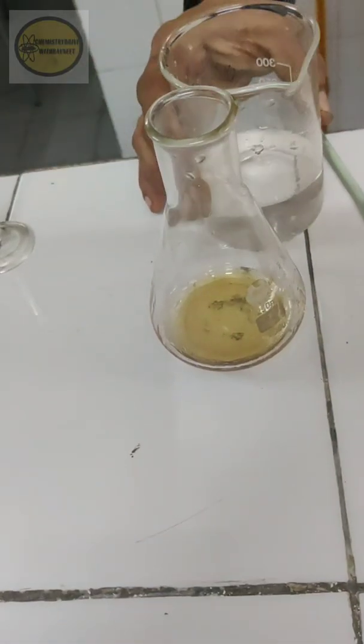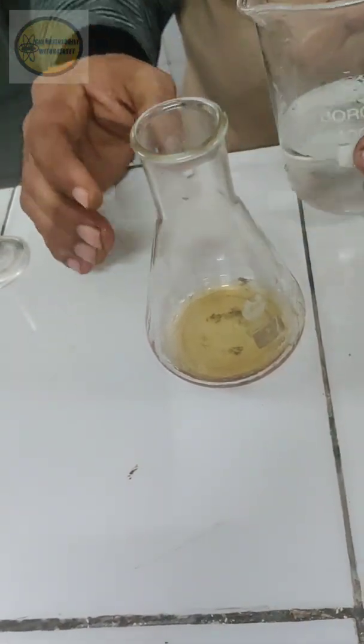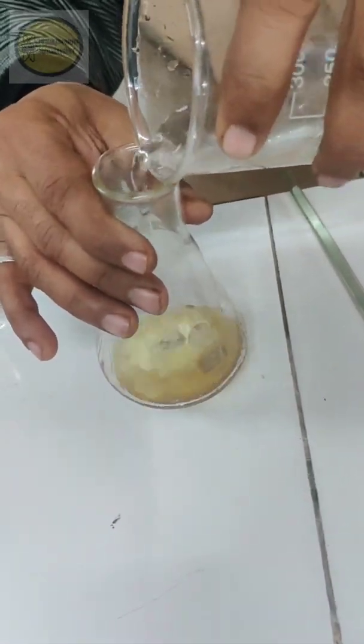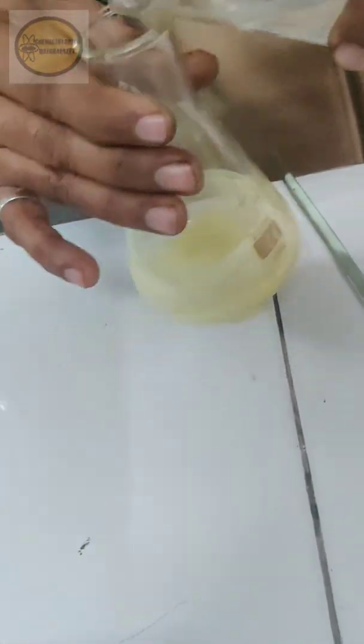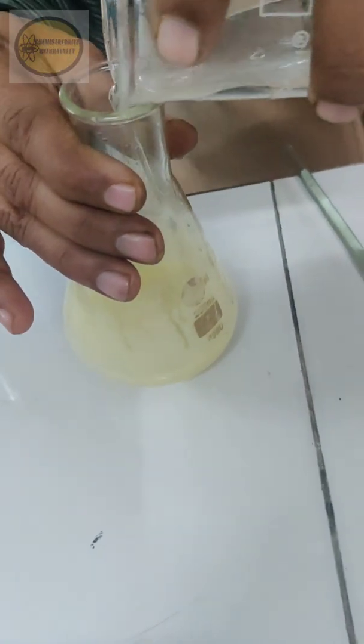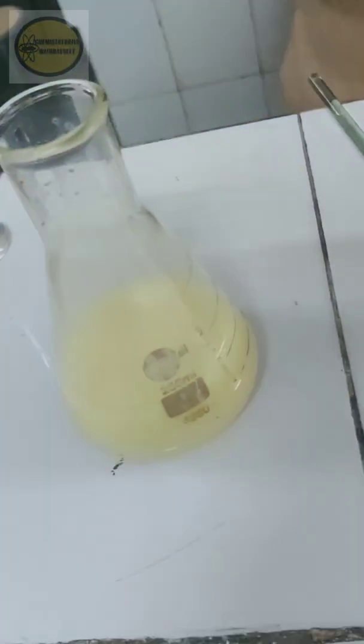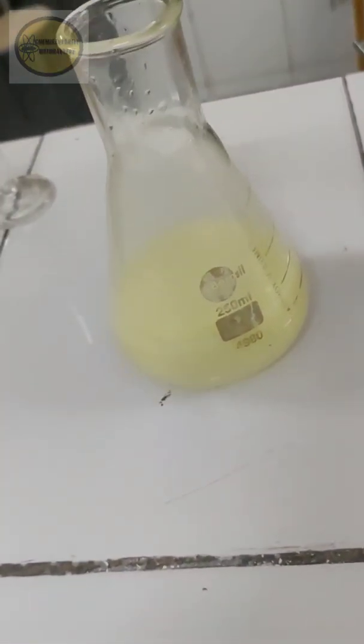After 30 minutes you have to either put about 50 grams of crushed ice or you can put about 125 ml of cold water to this solution. Once you add you can see you get the crude, that is your solid para-nitroacetanilide that is precipitated out. So pale yellow colored crude product we obtain. Again you need to allow this whole crude product to stand for 15 minutes for proper precipitation. Then after that we will do the filtration.